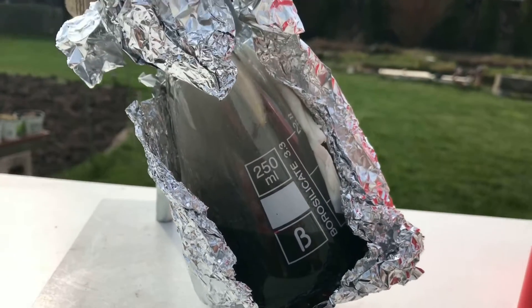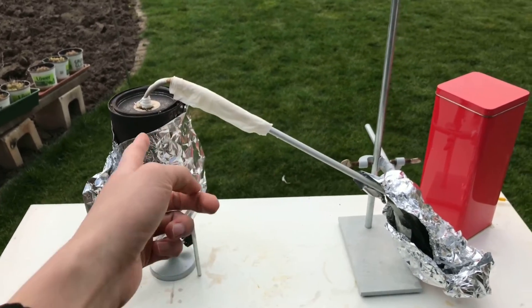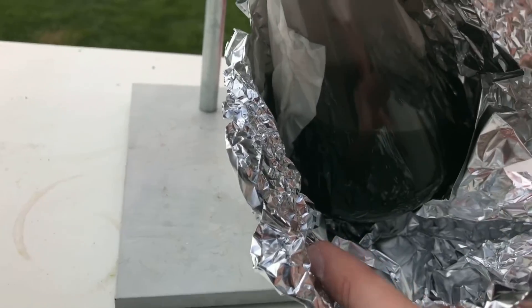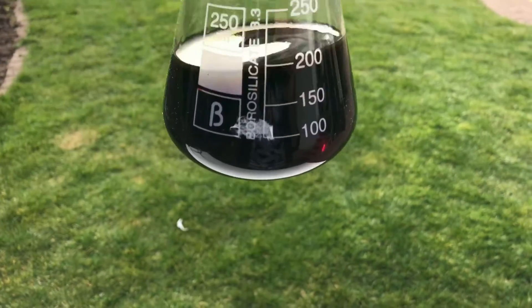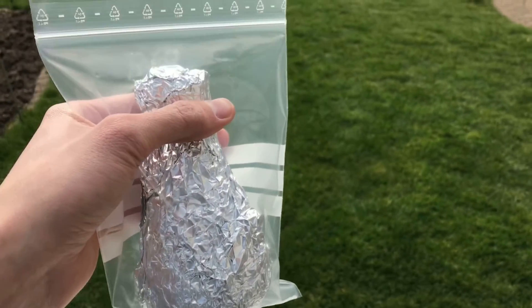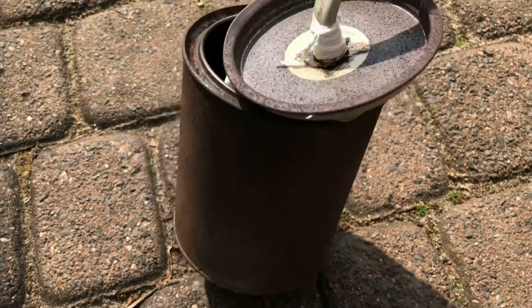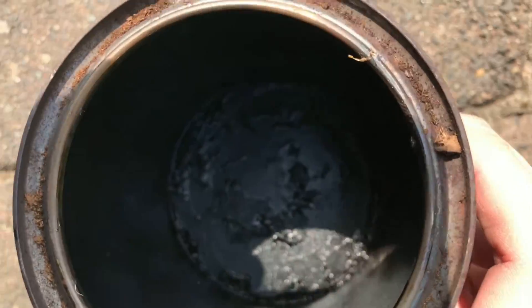About 100 milliliters of crude styrene were collected just from the first run. Because I still had some polystyrene left, I decided to do a second run. The procedure was finished once nothing came over anymore. The Bunsen burner was switched off and the apparatus was allowed to cool down. In total, it looked like we collected about 180 milliliters of crude styrene. The product is still impure, but it's clear — a little dark, but definitely clear. To keep it from polymerizing overnight, some vitamin C was added to bind radicals, and it was wrapped in aluminium foil and a plastic bag to keep light away from it. In the reaction container, there was nearly nothing left but tar. I'm going to keep the can for future styrene and benzene runs.